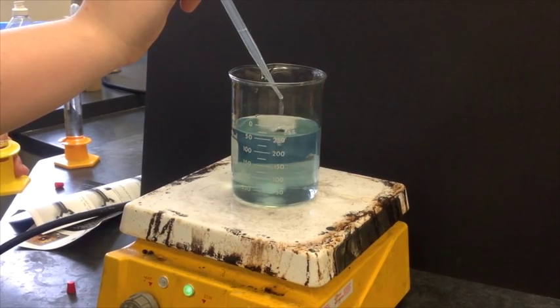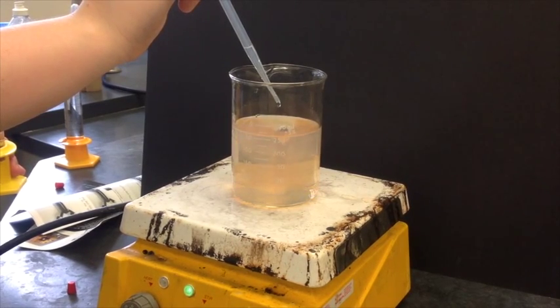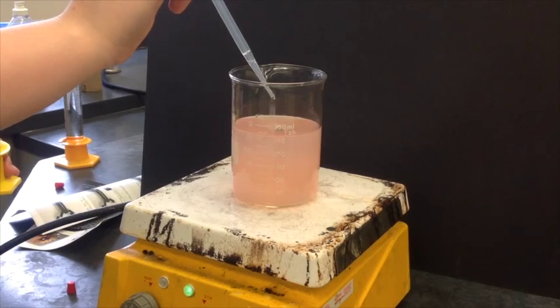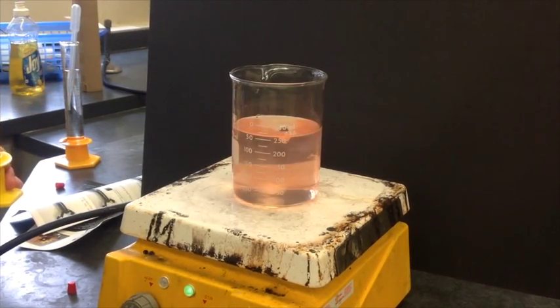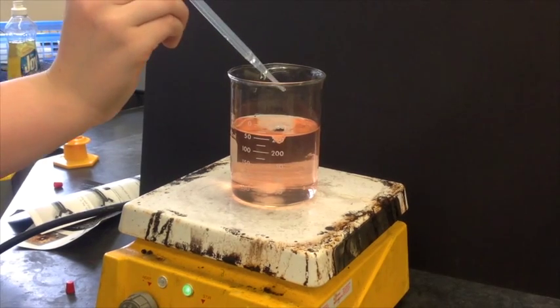It's turning green! And yellow! Now pink! Now a milky pink! And back to clear!